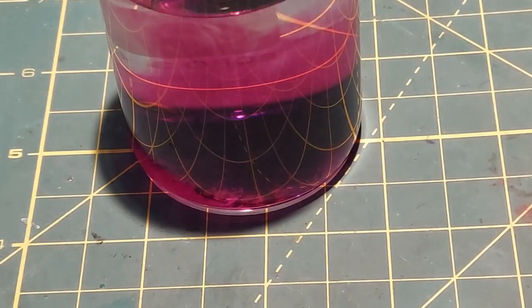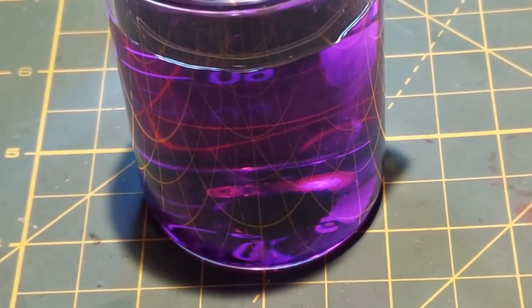You've got to be probably a chemist or a nerd at heart to appreciate this. I gave it a good mix and you can see it's swirling about.